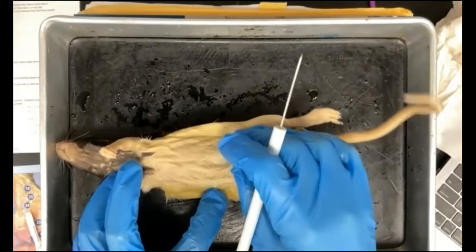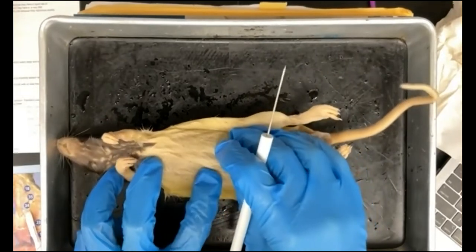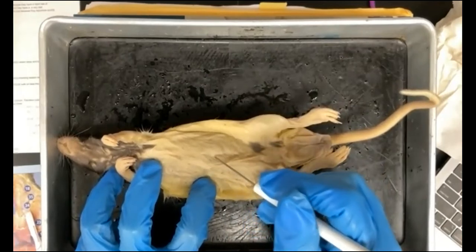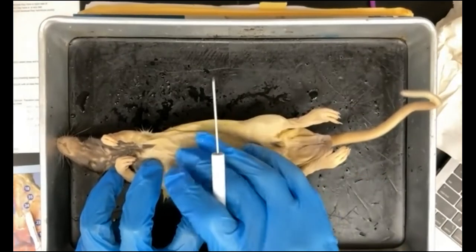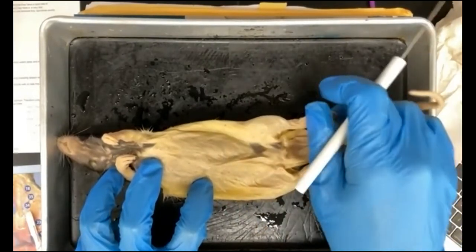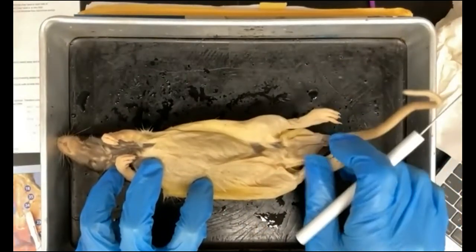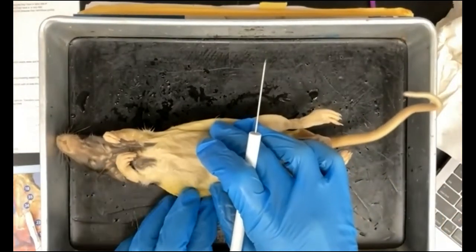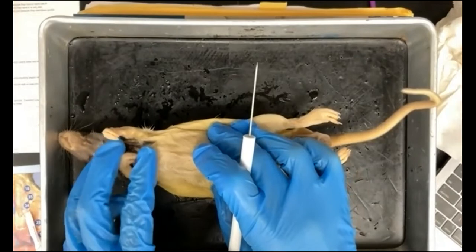These are things I think we instinctively know: rats will eat anything. And because their internal anatomy is very similar to humans, we use rats to test drugs like cancer drugs and other medication. They also reproduce very quickly, so we have a ready supply of rats.